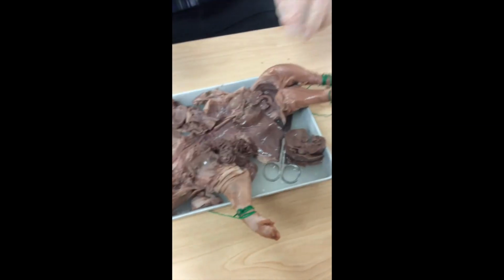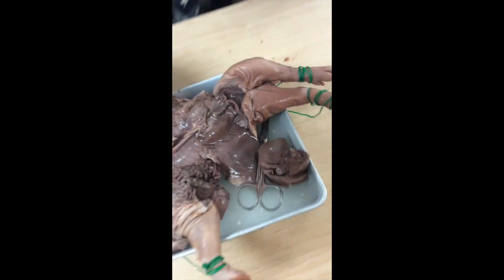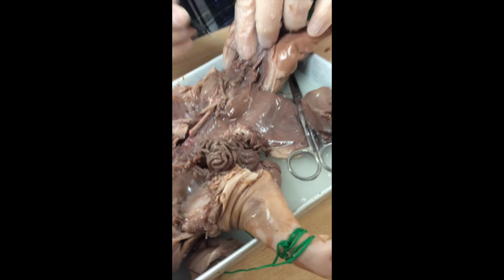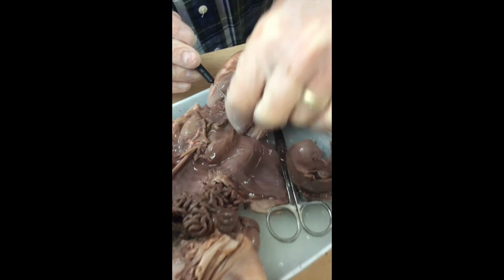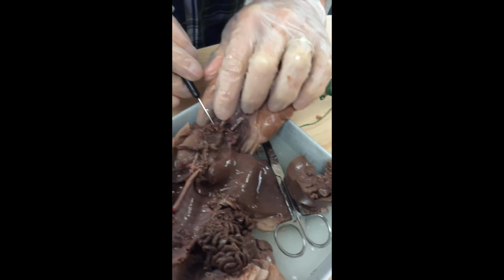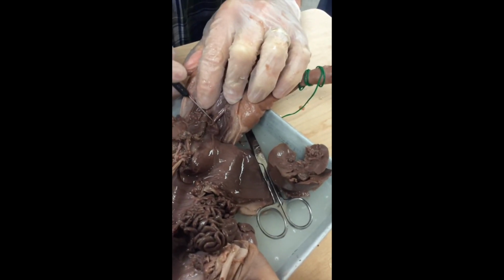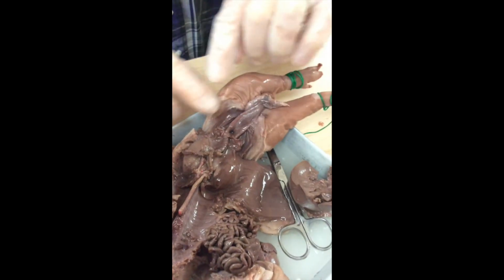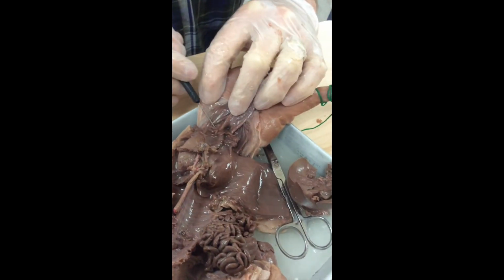We are on. I'm going to do another female pig, so I'm going to quickly show you some female parts here. I don't know how clear it is, but you can see, can you see these two wings of tissue right here? You remember the other day I showed you on the slide presentation the uterus of the pig and how it has two different branches.